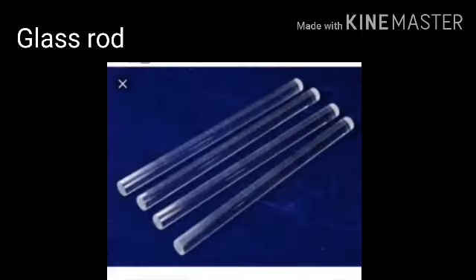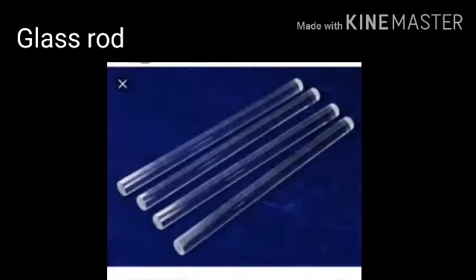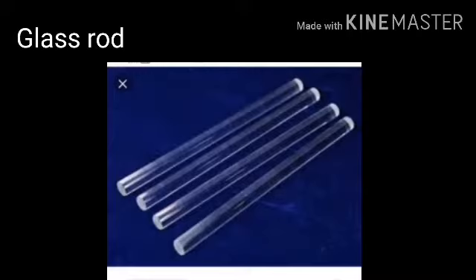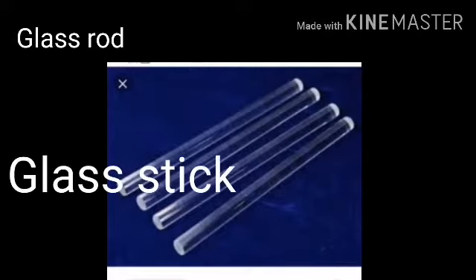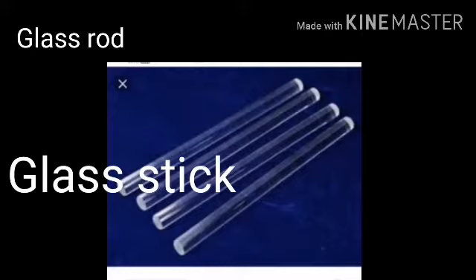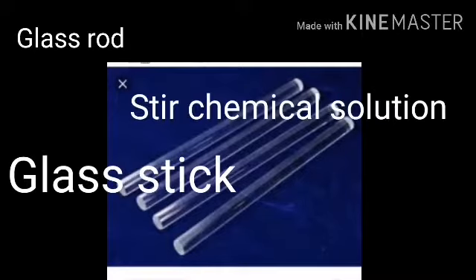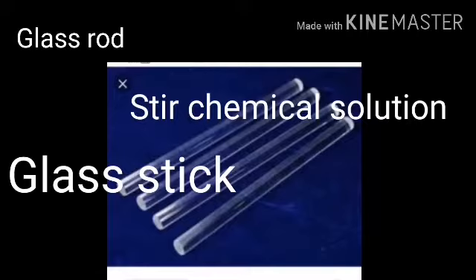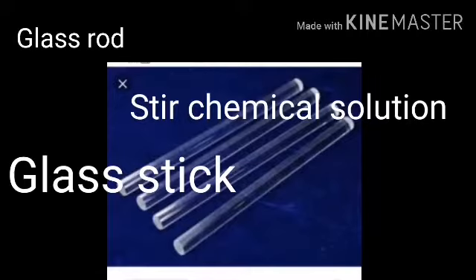Next, glass rod. A glass rod is a solid glass stick which is used to stir chemical solutions. Glass rod is just like a spoon which is used to stir chemical solutions.